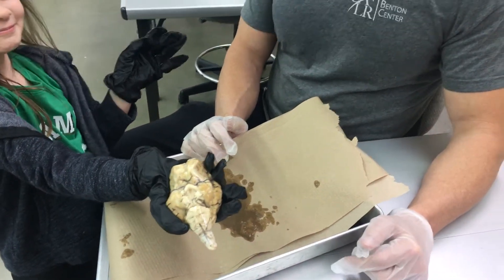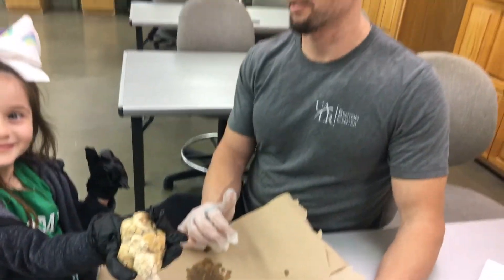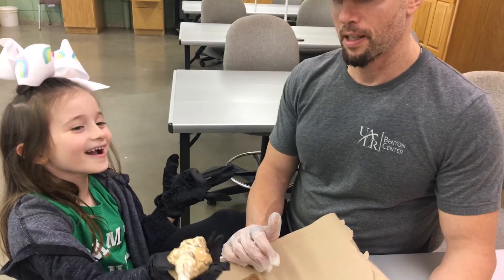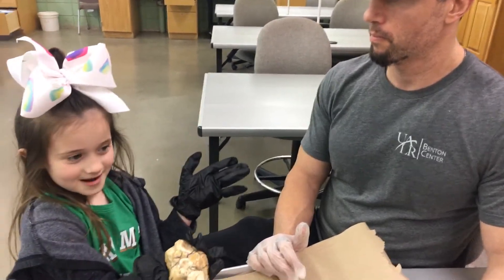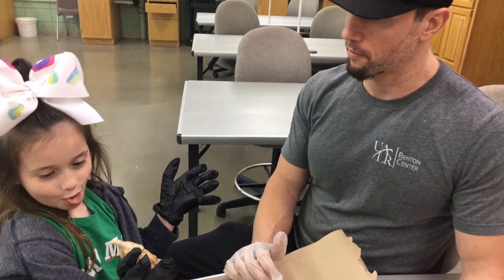All right, so we're going to do a brain dissection. My lab assistant here is Robert Kate Wanders. Tell them what kind of brain this is. A sheep brain. It's a sheep brain.